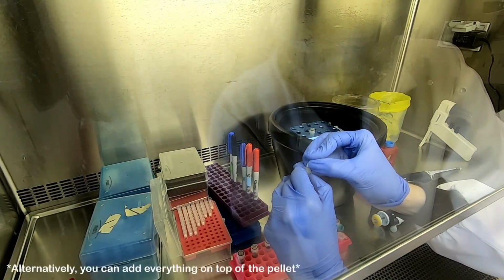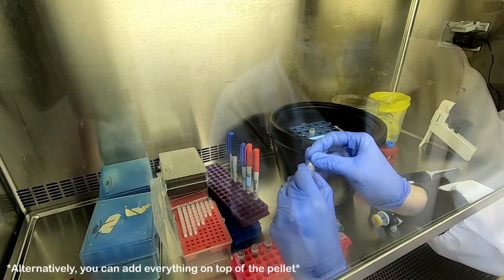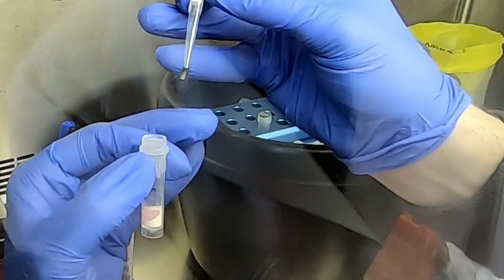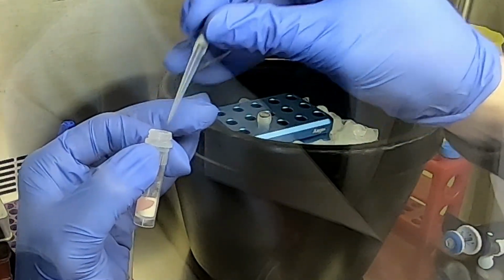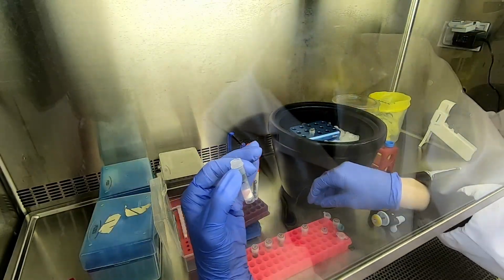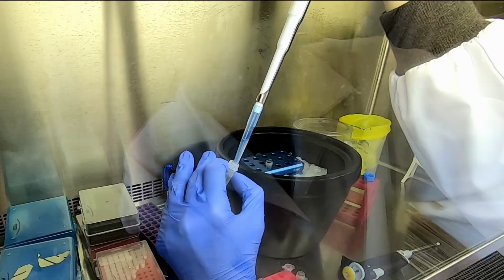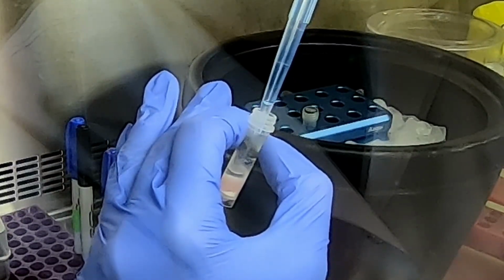Transfer the sample pellet to the tube with the beads and Trizol. Finally, add freshly prepared buffer to the tube and proceed directly to homogenization.